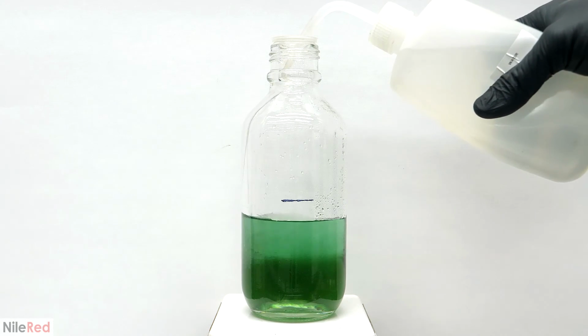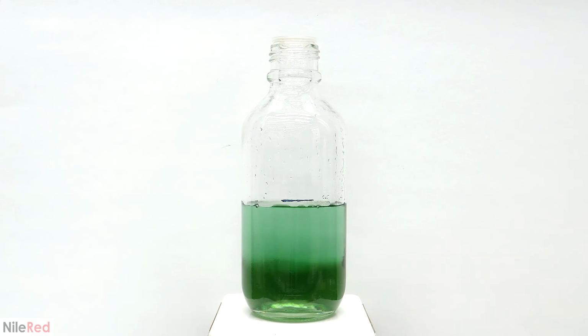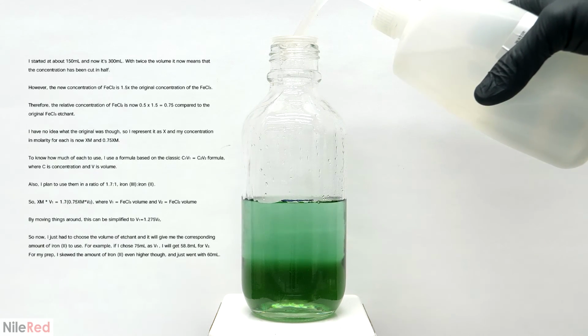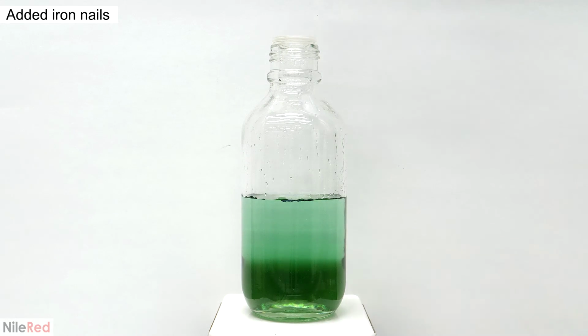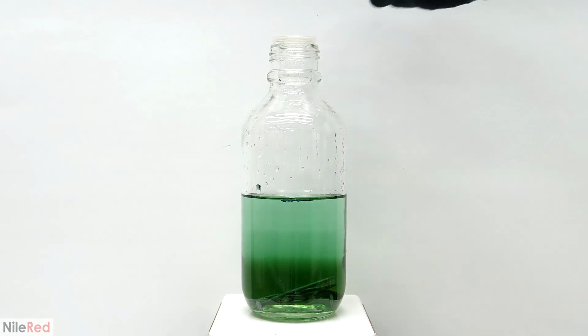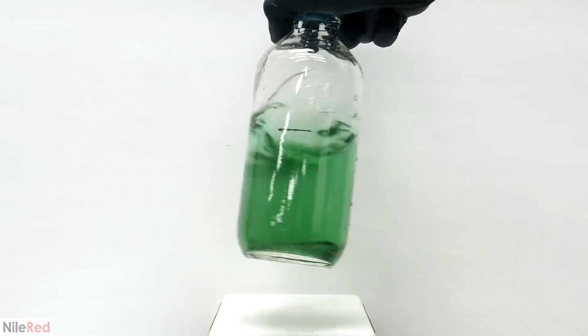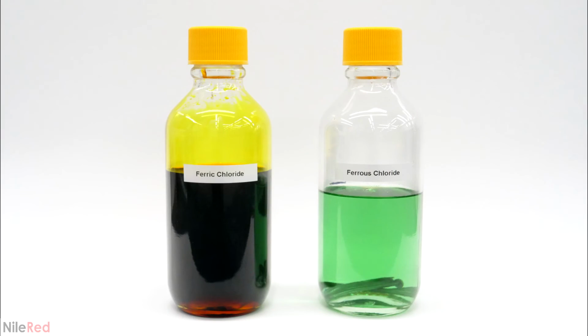This gave me a total volume of about 300 milliliters, and it let me calculate the relative concentration of this new iron 2 solution. For those that are interested, I've included all of the calculations that I did here, along with some extra details. But anyway, after this, I dropped in some iron nails. This iron 2 solution is easily oxidized back to iron 3 just by oxygen in the air. However, when these nails are added, it can reduce things back to being iron 2. At this point though, the iron 2 solution was ready, and I could now actually get things started.